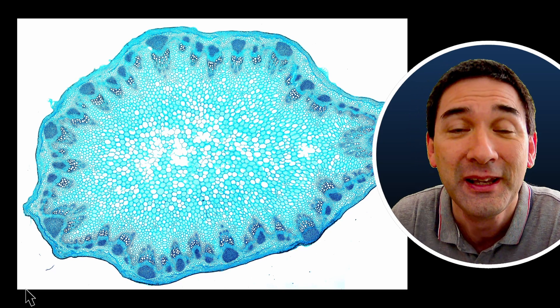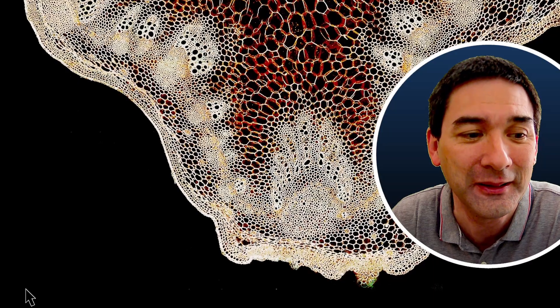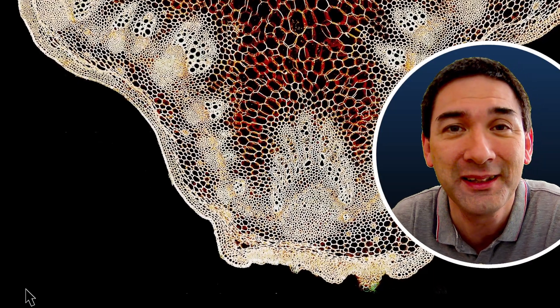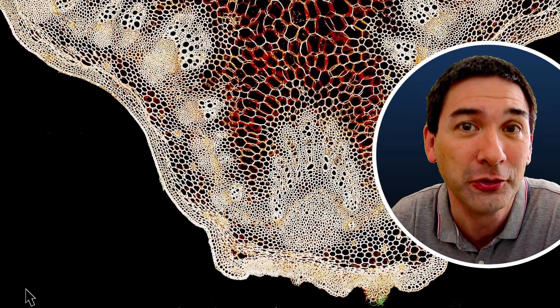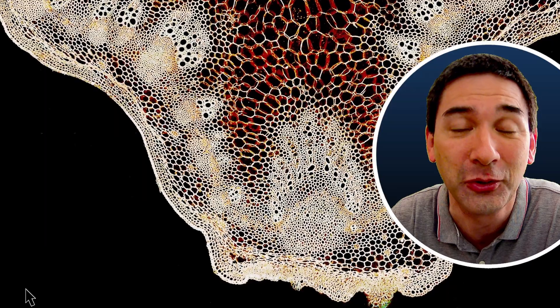So you see that the next time when you go out and look at some flowering plants, you can already think about whether they are monocots or dicots. And if you're not sure, then you can always put them under the microscope.